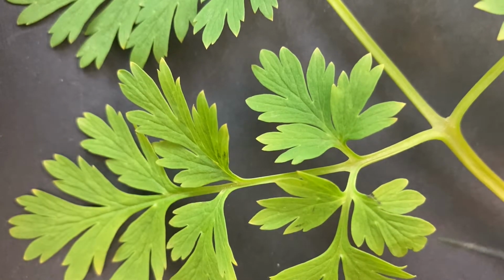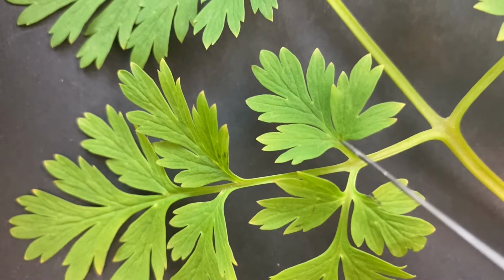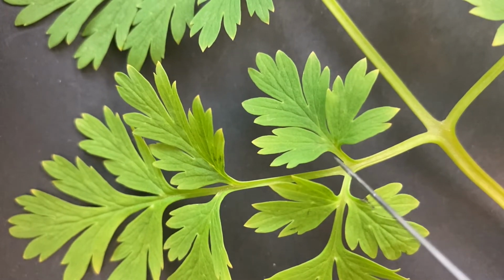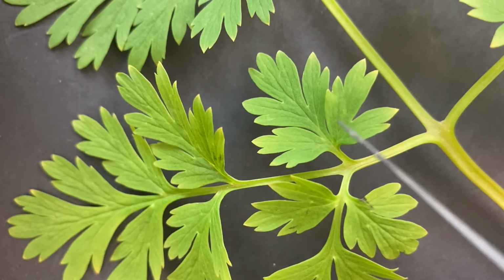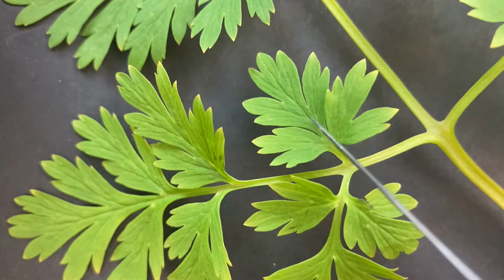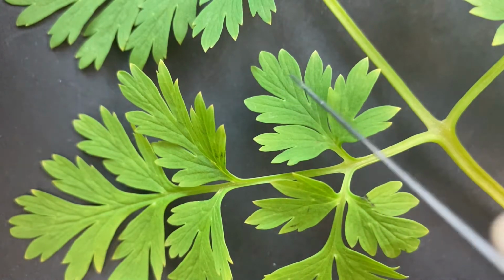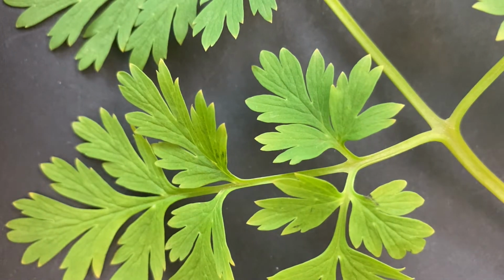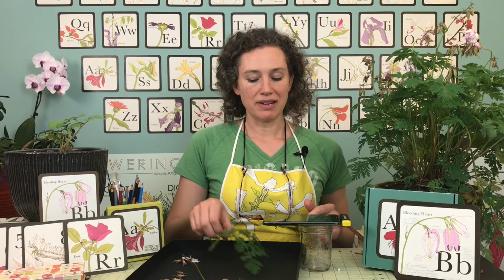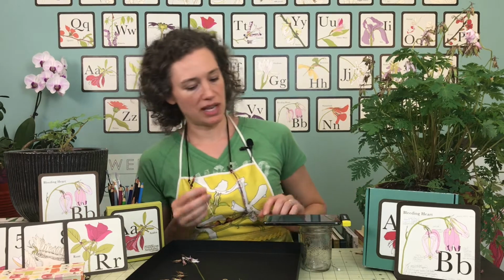The venation is how the veins are arranged in the leaf. So let's see which one is going to be easy. This one looks pretty good. If we go up this central vein right here, it branches to the left and to the right, then it goes up some more and branches to the left and then branches to the right, then it goes up, right, left. As it keeps branching up, that's the same thing we saw here. We saw this central one and the branching out to the side, so it's going to have the same name, pinnate. So the venation is pinnate, okay? All right, so that is our leaf shapes and names. Lots of ways to classify things.